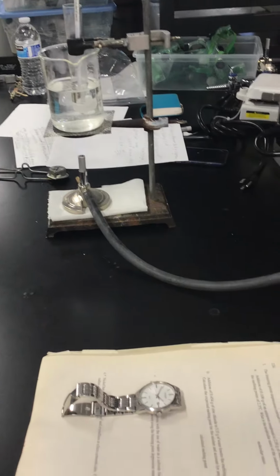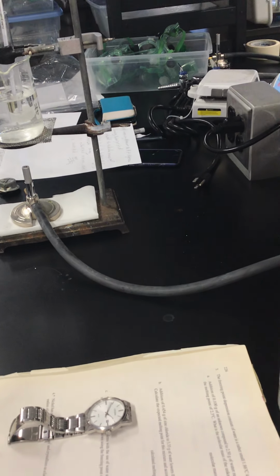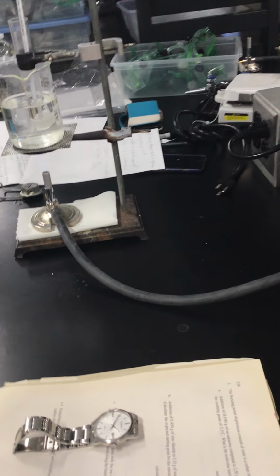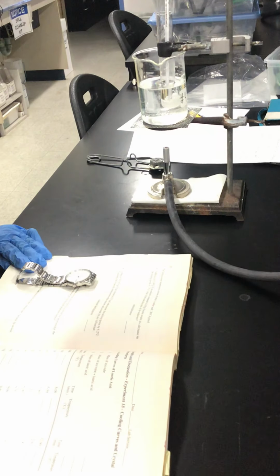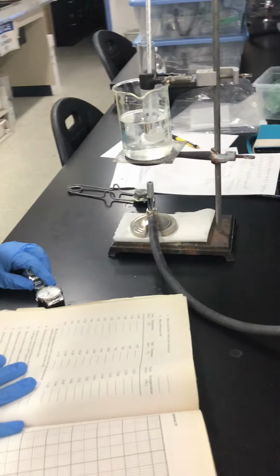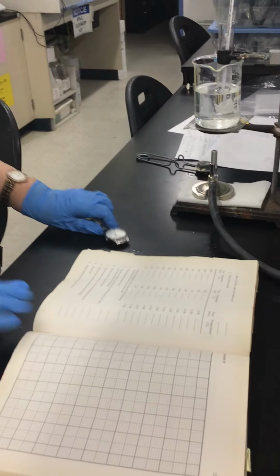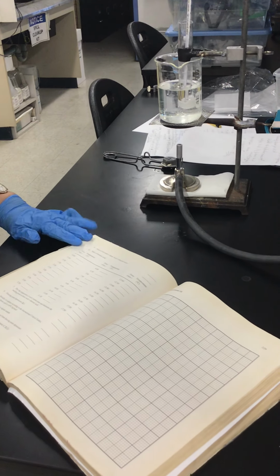We are heating it, right? Same thing. I'm going to make the graph. You have the other graph, right? Yeah, 50 degrees. Okay, now with benzoic acid, here is the table for when we add benzoic acid.